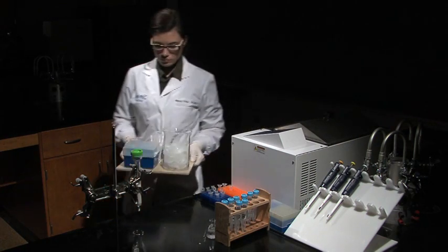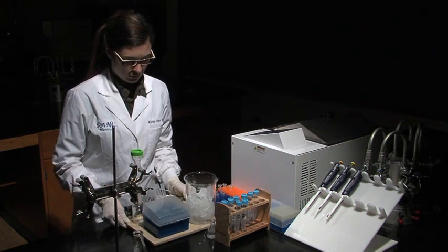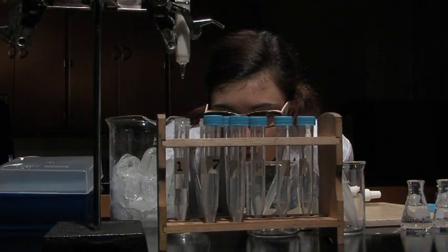Label eight tubes, one through eight. Add one milliliter of unpurified ECO-R1 solution and allow it to completely enter the column.